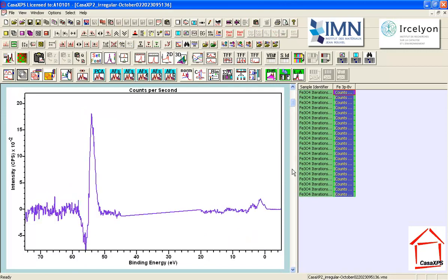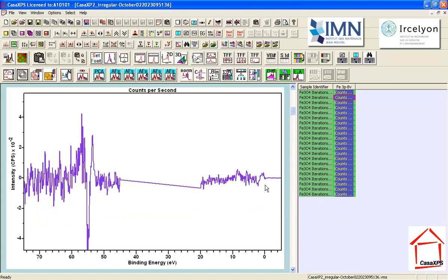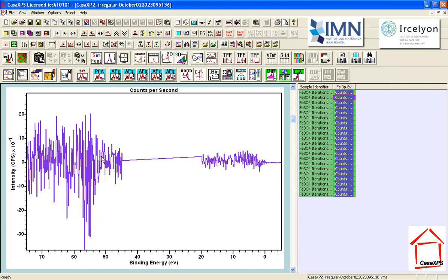And immediately when I look at the second abstract factor, this is now in this VAMAS block here, the process data in this VAMAS block, it's showing me that a change did occur. Very subtle, but it did occur throughout these iterations. There's something perhaps in the third abstract factor, and then the fourth abstract factor looks entirely consistent with noise.